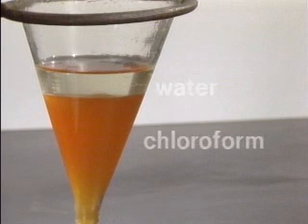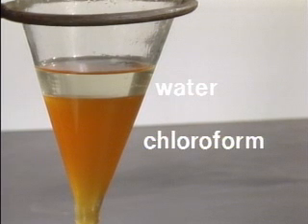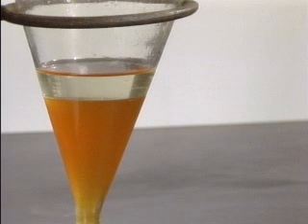The water, or aqueous layer, is not as brown as it was before because some of the bromine has been extracted into the chloroform in which it is more soluble. It is possible to determine how much bromine is in each layer and then determine the distribution of the bromine between the two immiscible solvents.